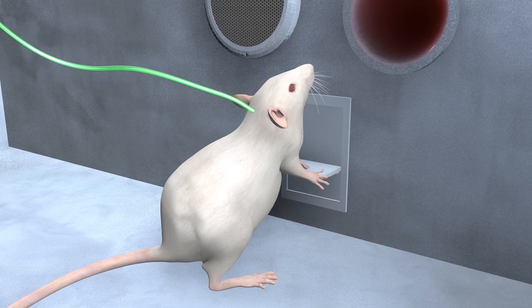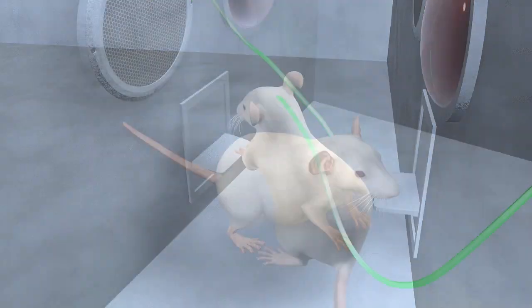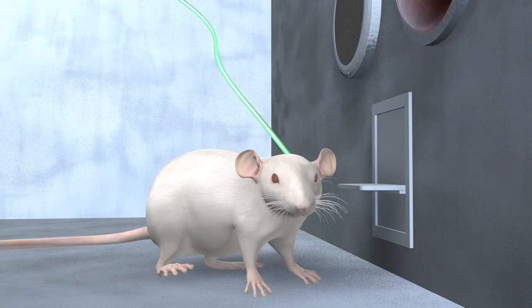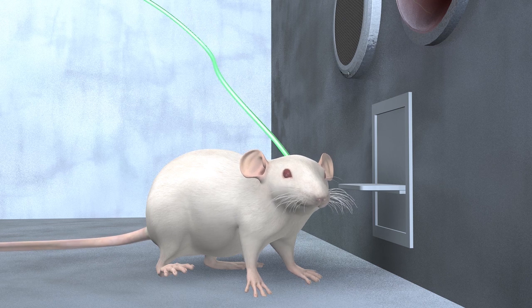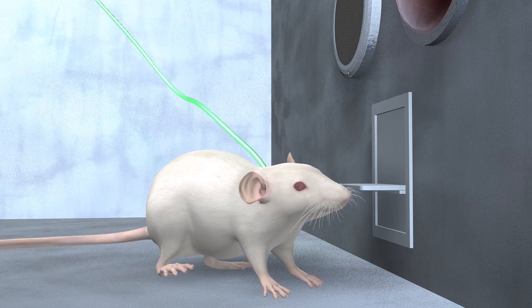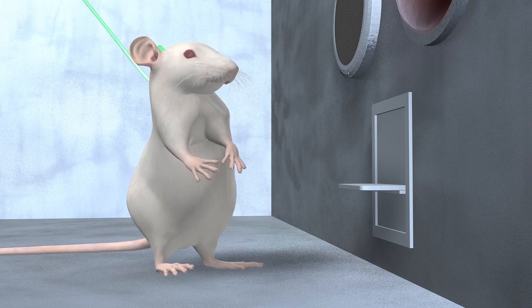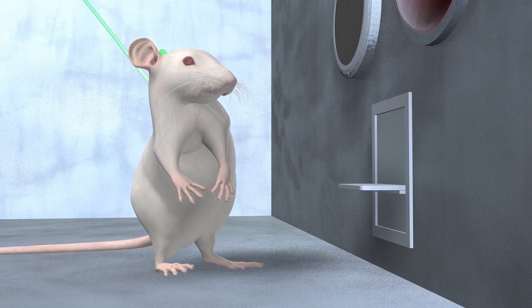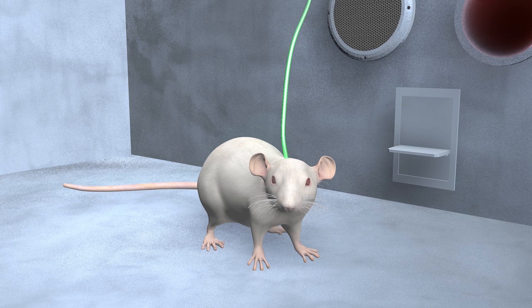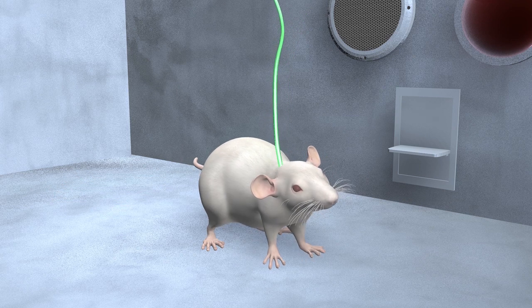The rat presses again and again. Gradually, it learns that pressing is futile and tapers off. When the rat's rate of lever pressing falls to near zero, the extinction phase ends.